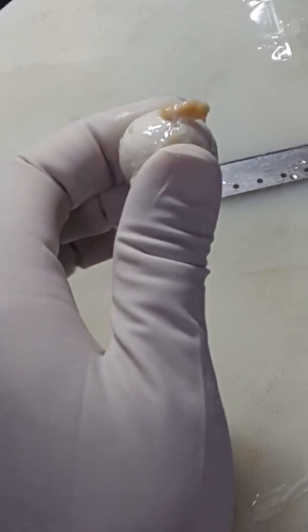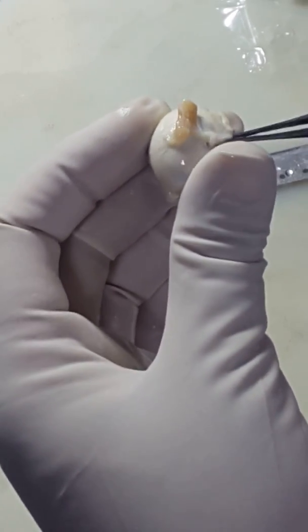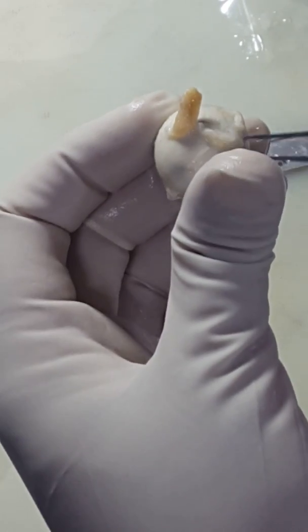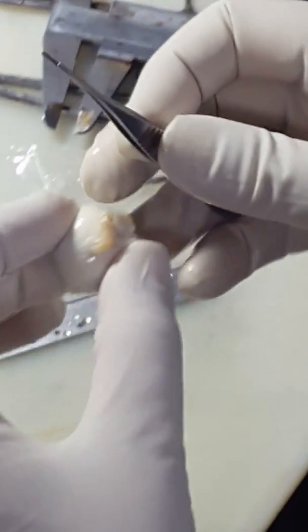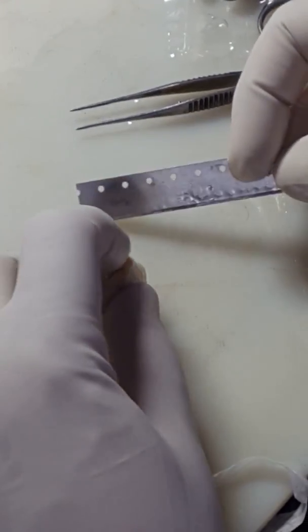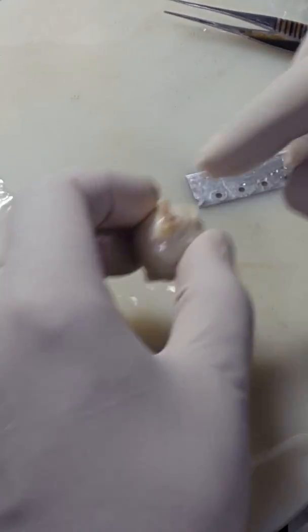We have to find out which eye this is. The inferior oblique is on the temporal side — this is the right eyeball. The inferior oblique on the temporal side indicates the macula location. Now make a beautiful optic nerve section at a slope.